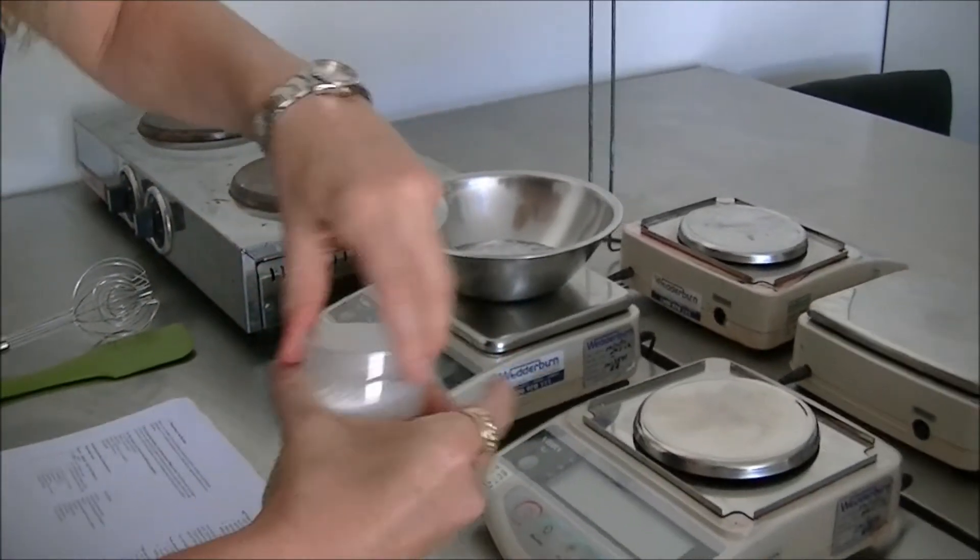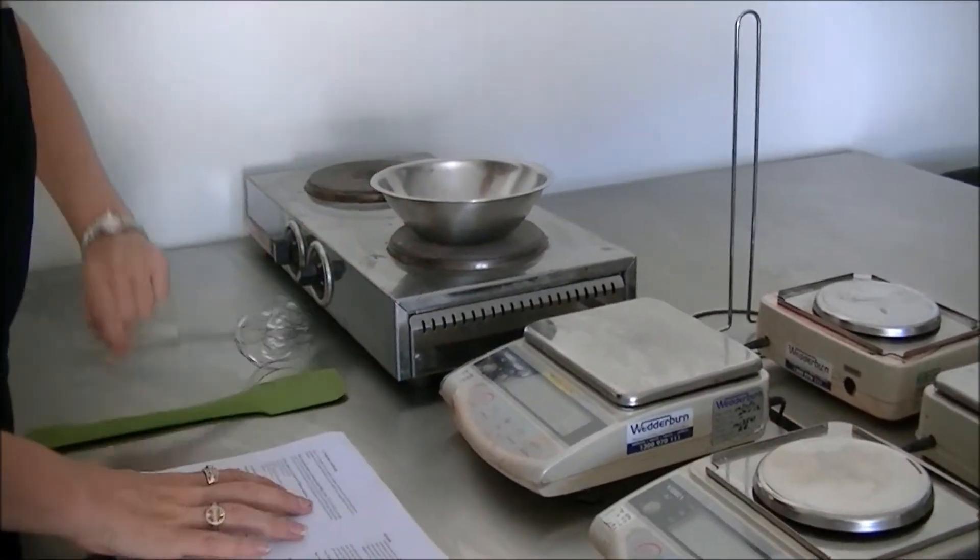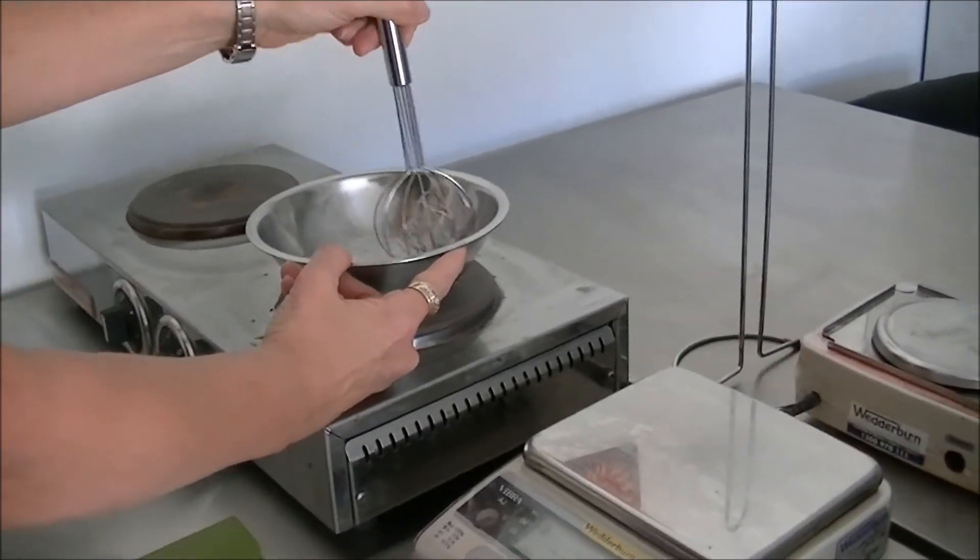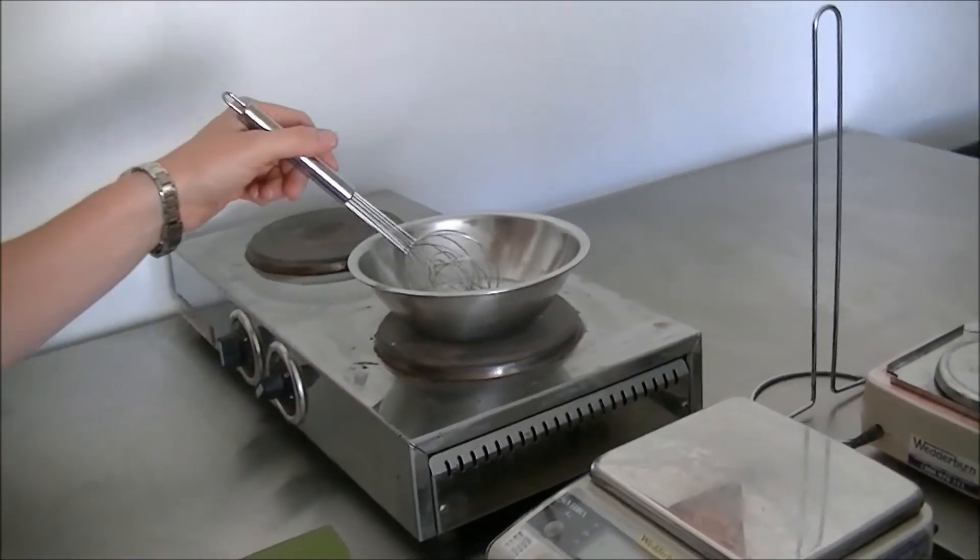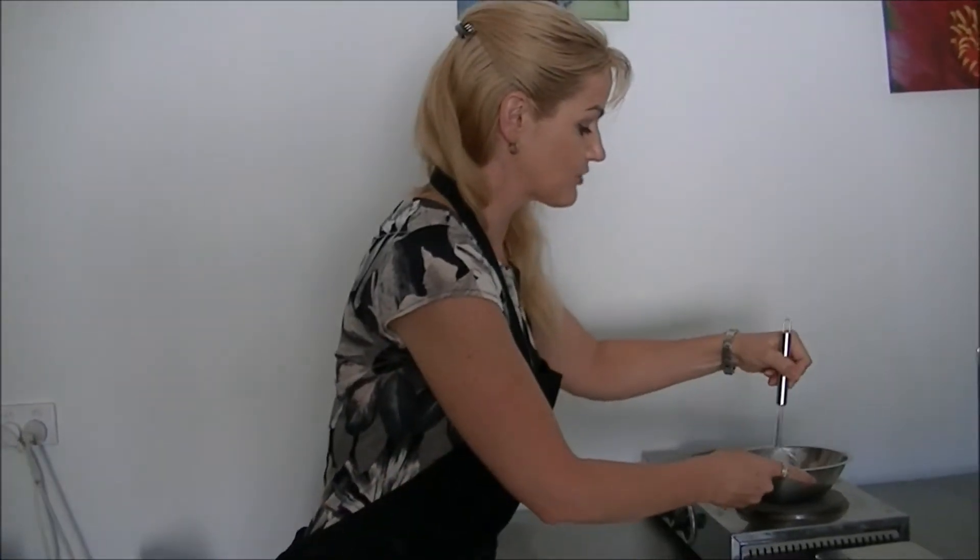Now I'm just going to heat this gently until they dissolve. One of the important things when you're creating samples of surfactant products is that you will get a lot of bubbles if you introduce a lot of air. So all stirring should be done quite slowly and gently so that you don't introduce too much air into the product.